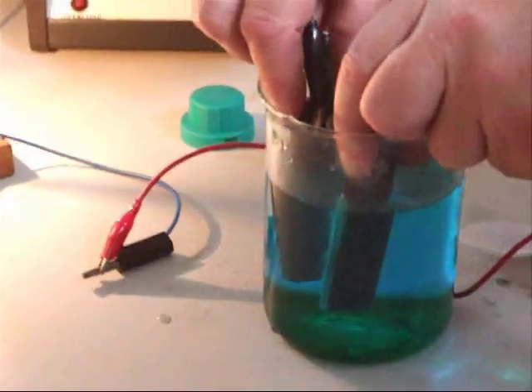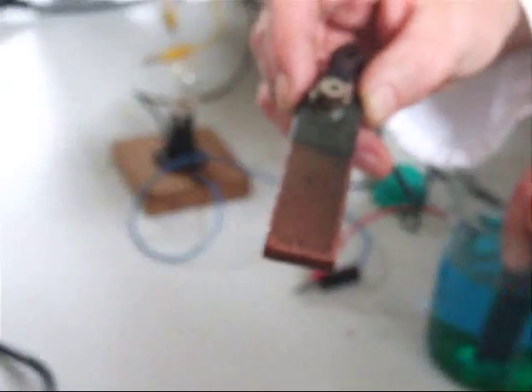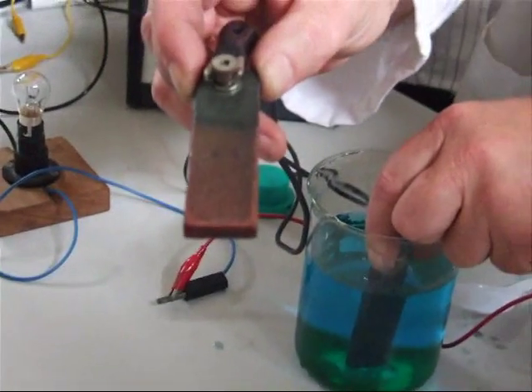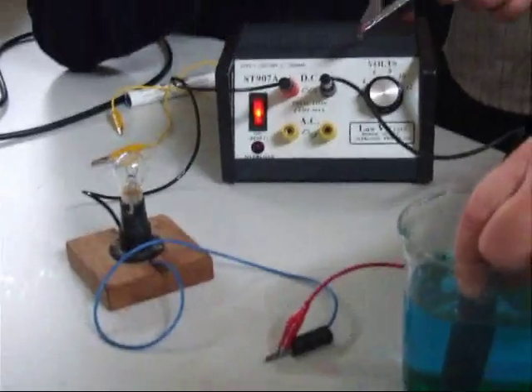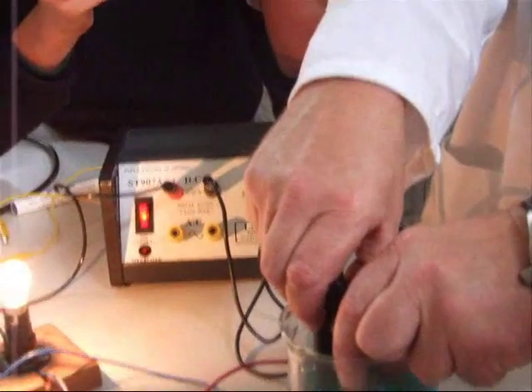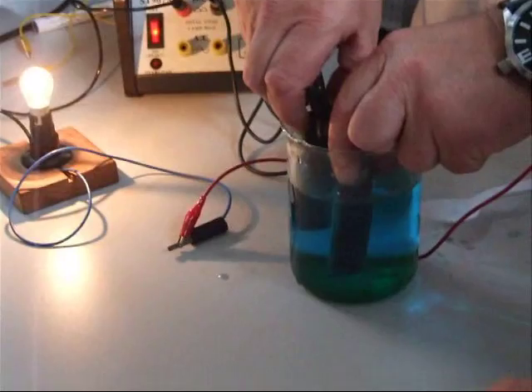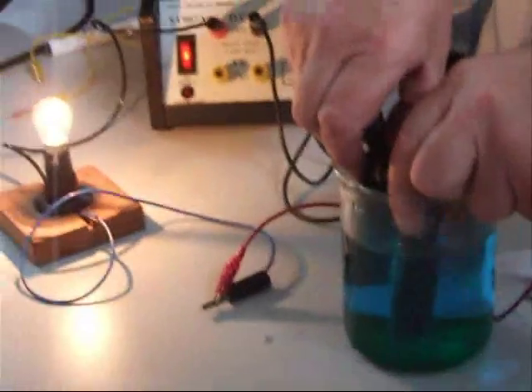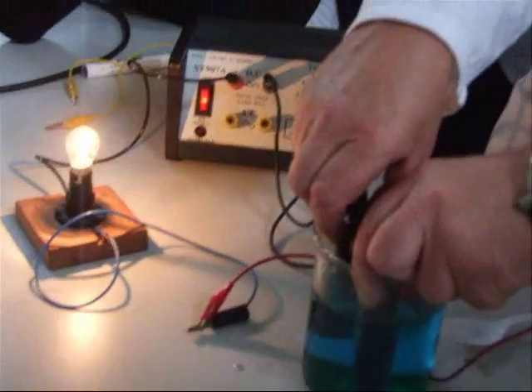We can't see just for the minute what's happening at the other electrode. If I take the other electrode out and show you it — it's red. What do you think that red stuff is? It's copper. The copper ions move to the negative electrode. This electrode has those extra electrons — it's trying to give electrons away. What charge is a copper ion? Positive. To turn it into a copper atom, it has to gain two electrons, and it's getting those two electrons from the power pack.